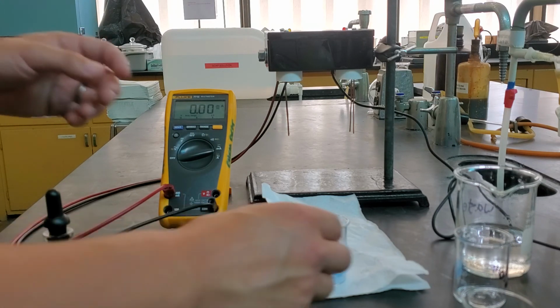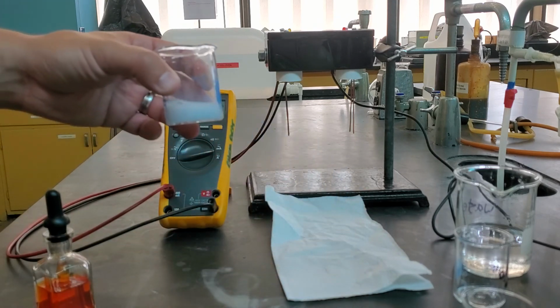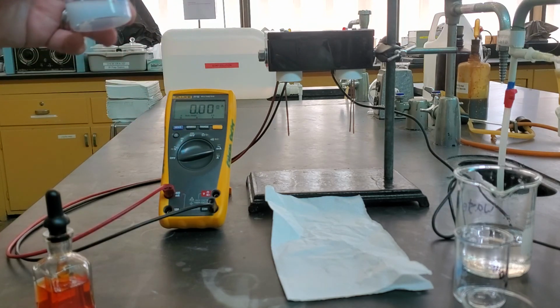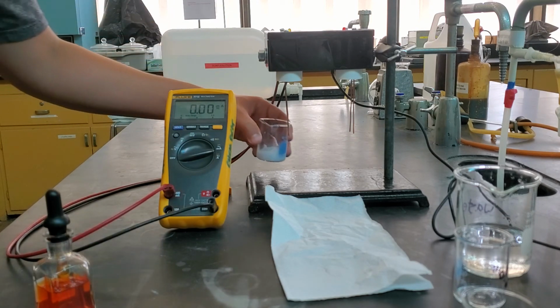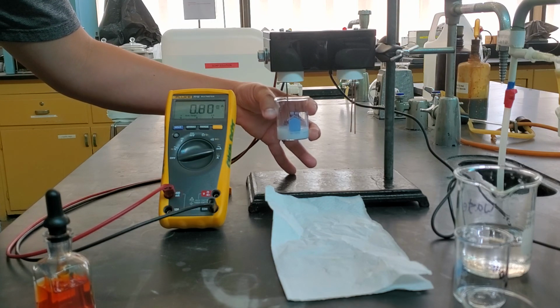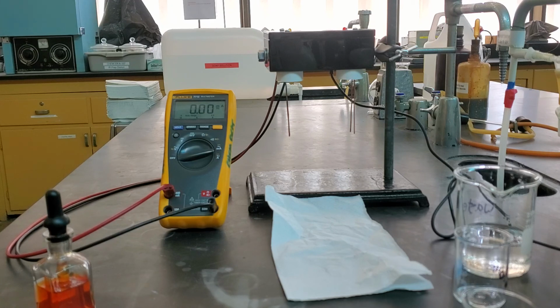Now we have them. We can mix them up, and we can go ahead and take this measurement by recording its mixture. There. So you can see how that has changed. There you go, and that's the end of our 3 experiments.